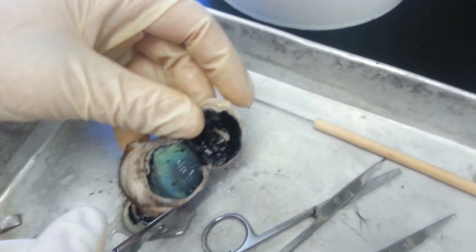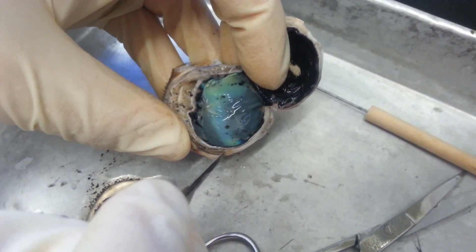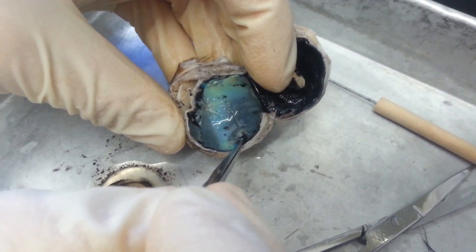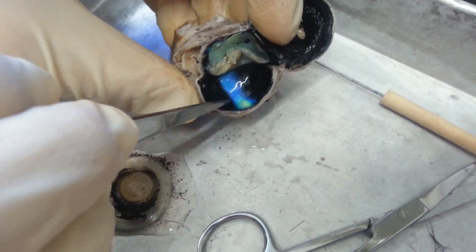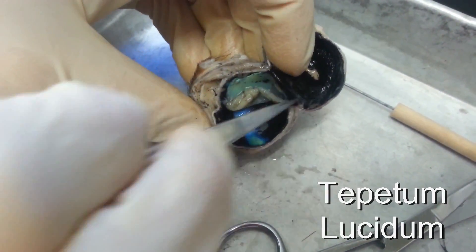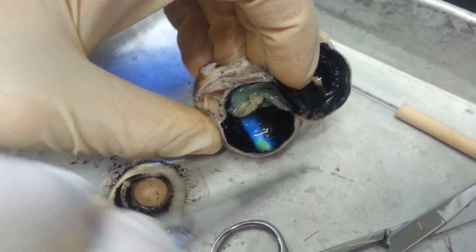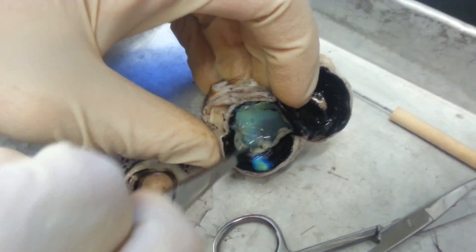On the back, the sclera is the white fibrous connective tissue layer, and then you have two other layers. The retina is this whitish area, and the choroid coat is the layer behind it. You can also see something shiny and very reflective back there — that is the tapetum lucidum, which helps reflect light even when it's dark. Humans don't have this, but dogs and sheep do, and that's why if you shine a flashlight into their eyes at night it will shine back at you. And that is all of the eye structures you need to know.